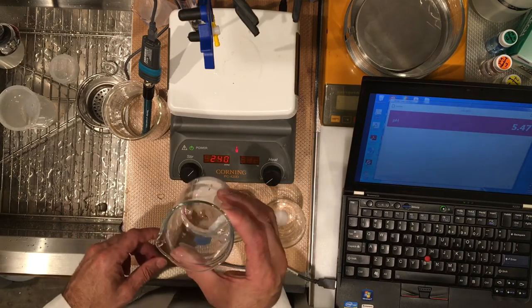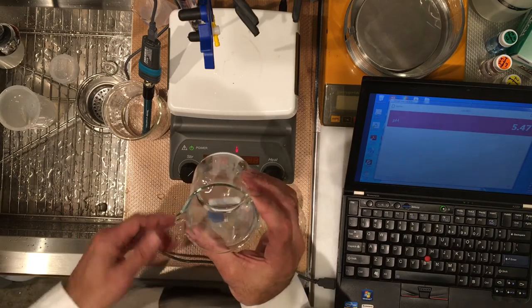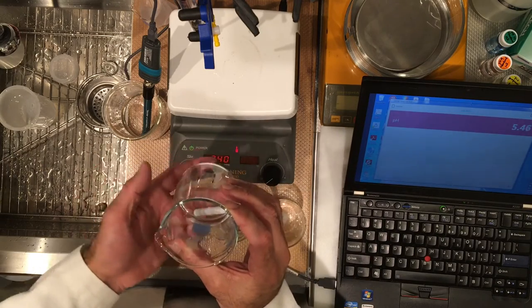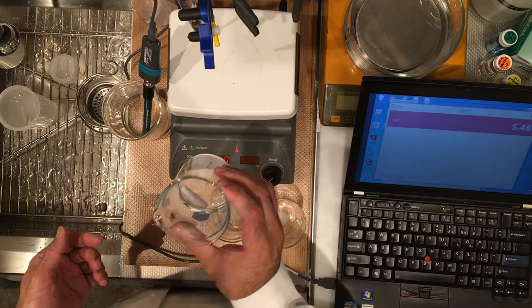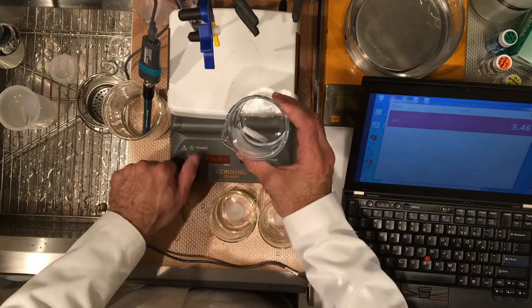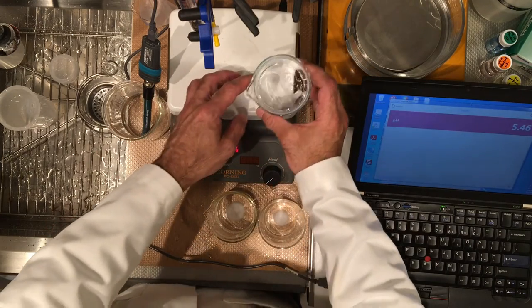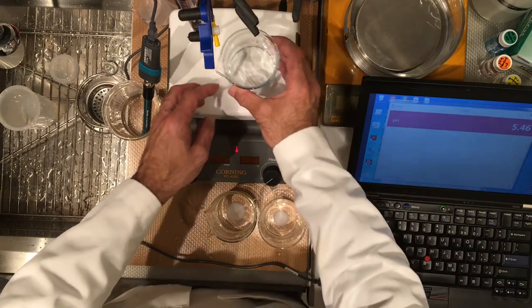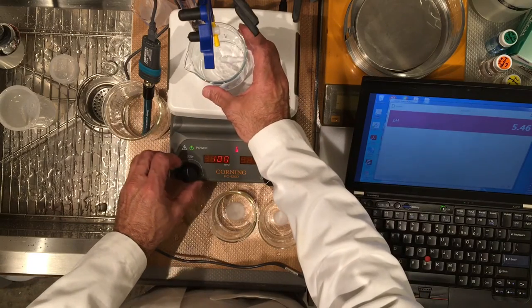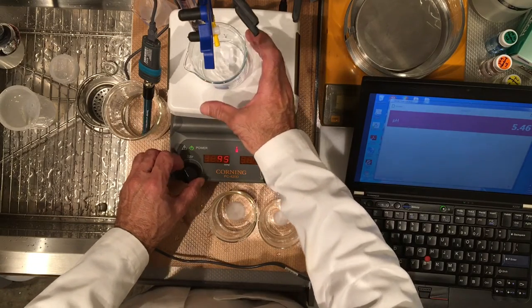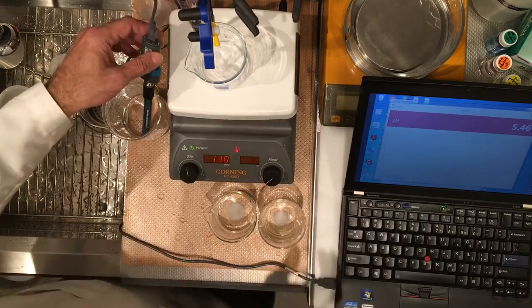I see a tiny bit maybe, no, these are bubbles. Okay, so we're good. Let's go ahead and put the probe in.